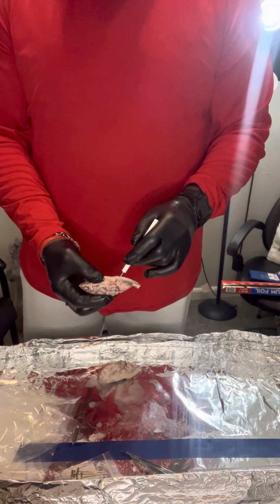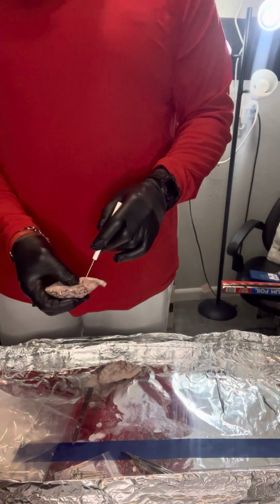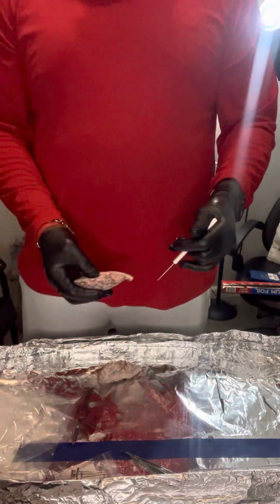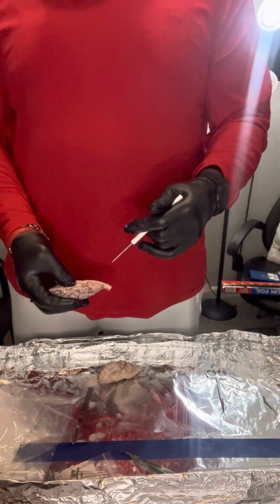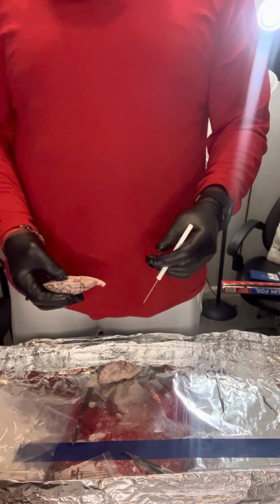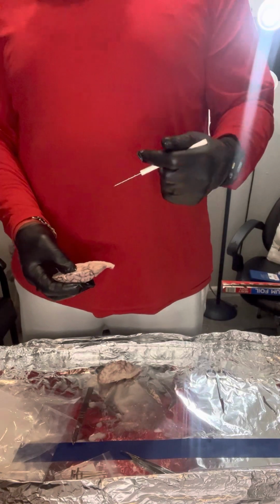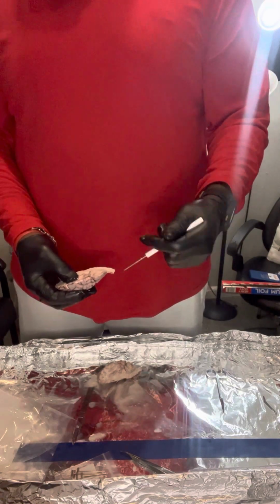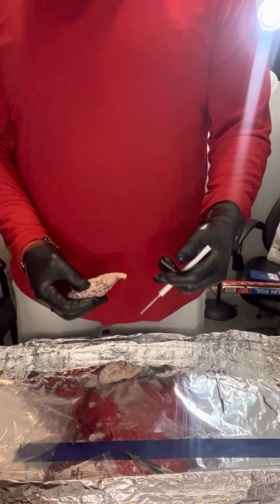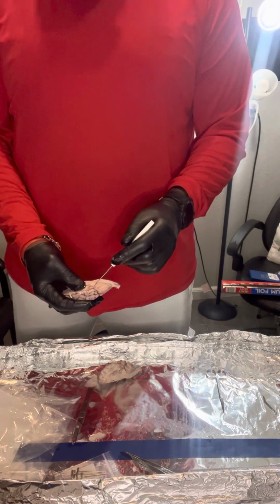Inferior colliculus, which involves sound localization, frequency determination, and integration of auditory with non-auditory systems. So again, it takes sound, communicates it to what doesn't hear sound, and makes it all come together. So it brings all our senses together and causes us to respond or react, to walk, to move, to have balance, to see, to engage, to interpret, based on the senses working together as one.